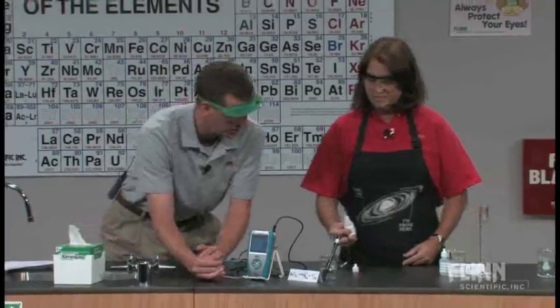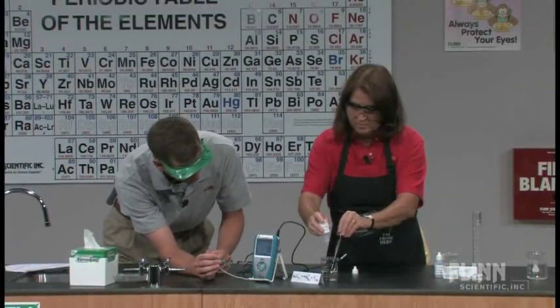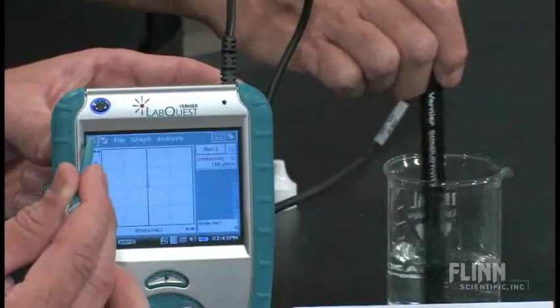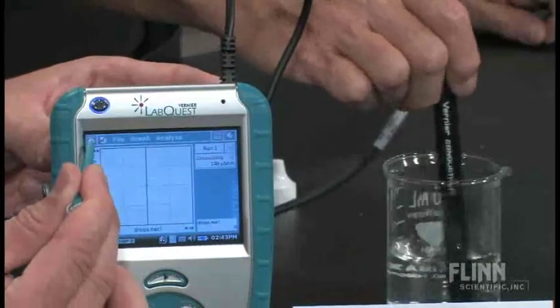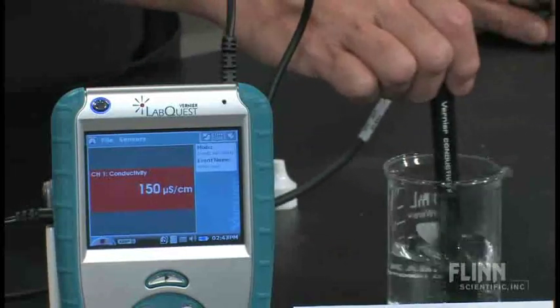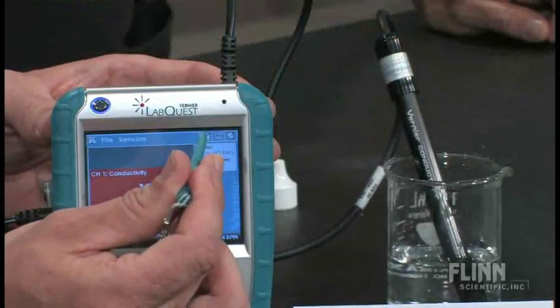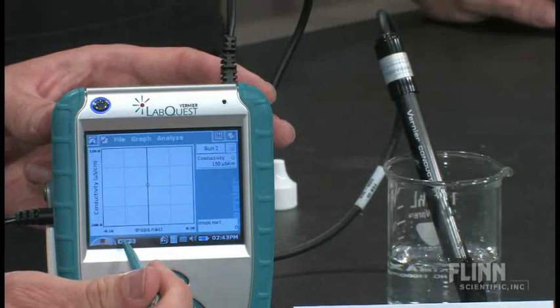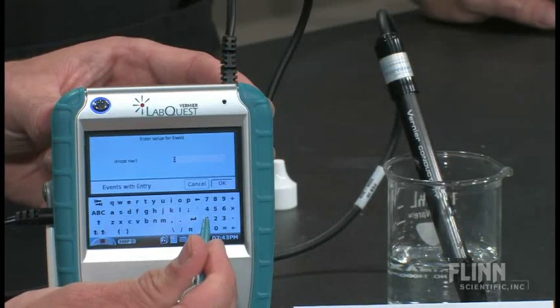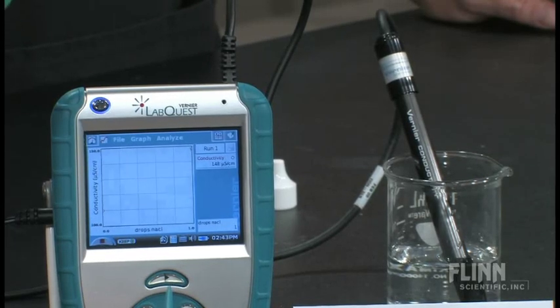At this time, Penny's going to put in one drop of sodium chloride and give the beaker a little swirl. What I want to do is switch back and we're going to see if that has changed. We can come back to that graph and watch that change. That should be a little bit higher from where it was before. Once that settles out, we can keep that data point. So we're going to hit keep and type in the number of drops of sodium chloride. At this point in time, it is one.